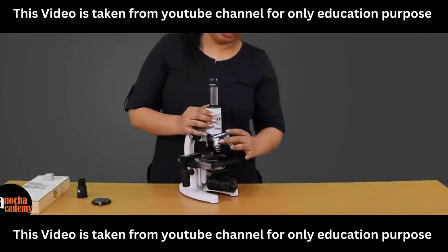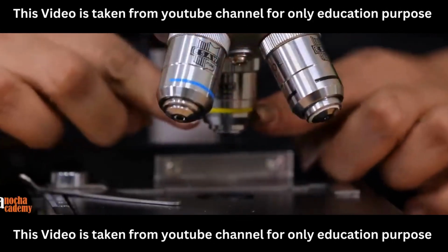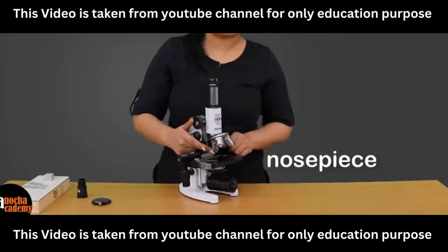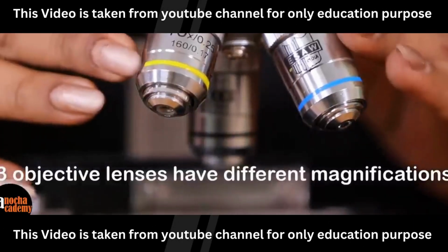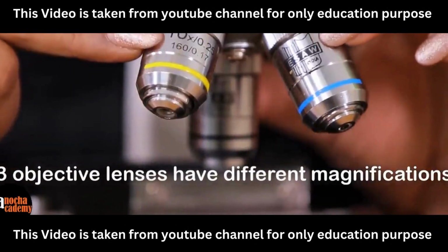At the base of the body, we have this rotatable disc which is known as the nose piece. The nose piece in this microscope has three lenses attached, and these lenses are known as objective lenses. If you look closely, you will see that all these three lenses have different degrees of magnification mentioned on them.